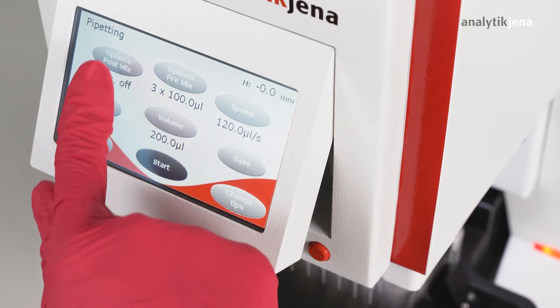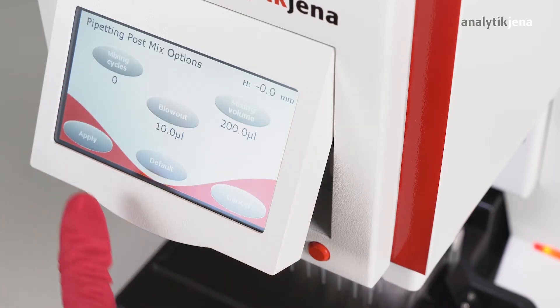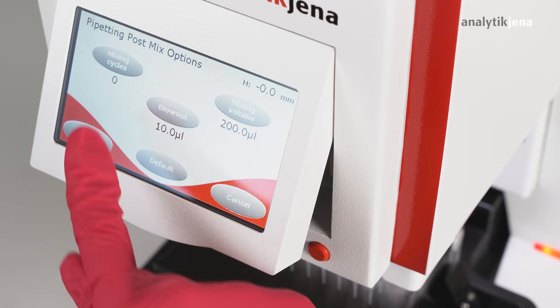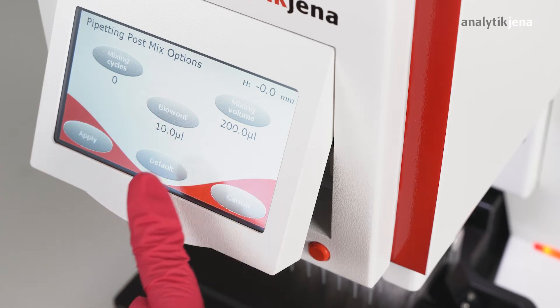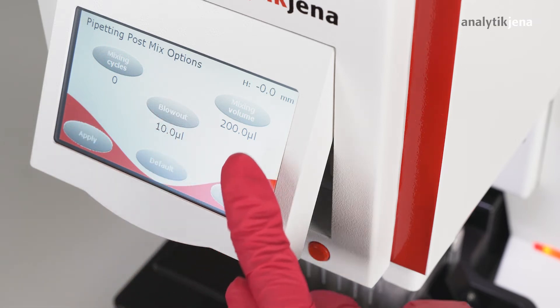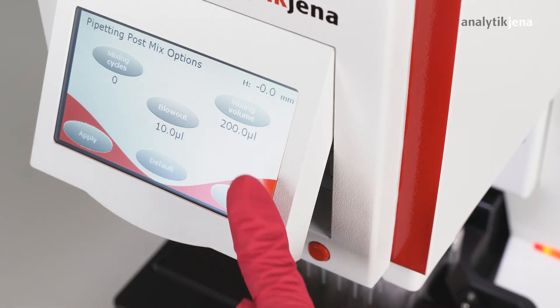For the post-mix: the number of mixing cycles is 0, the blowout volume is 10 µL, and the mixing volume is 200 µL.